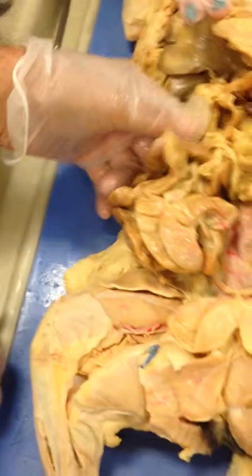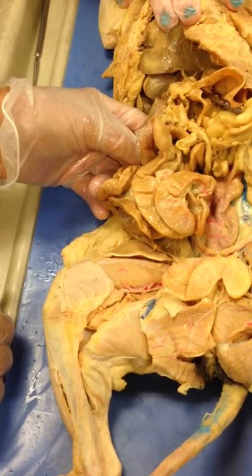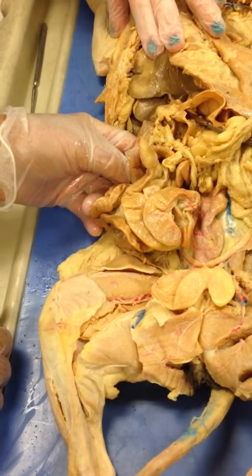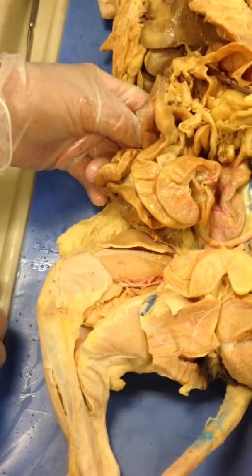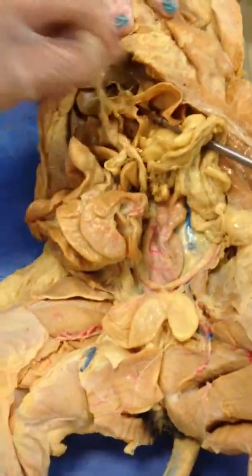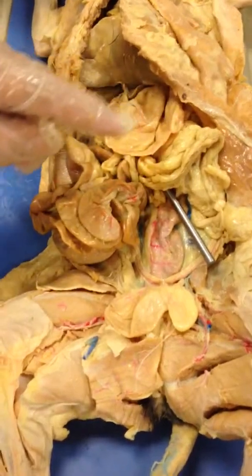That ain't too hard. No. Did you see what I was doing? Could you do that over there with your stomach? Right here. It's not cut open. It's not cut open? No, sir. But where it connects. Well, go ahead and cut the stomach open. Cut it along the greater curvature.